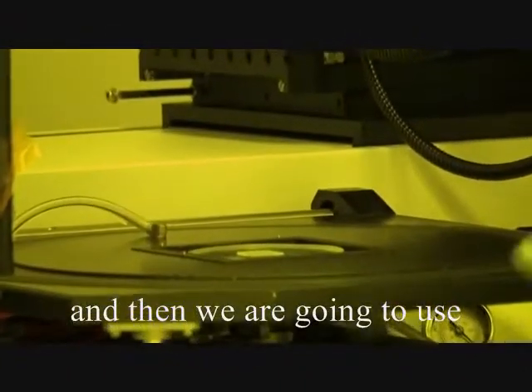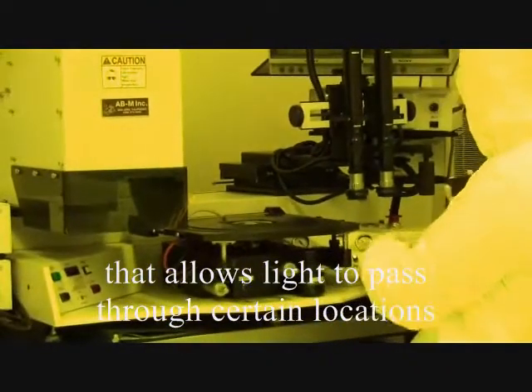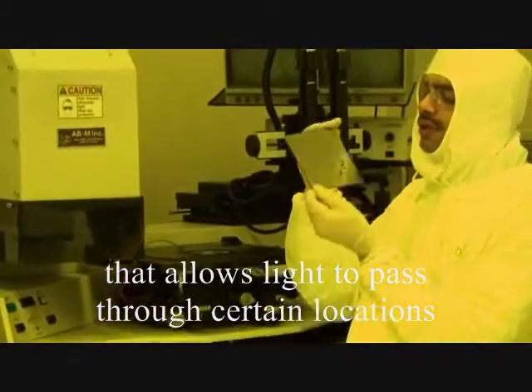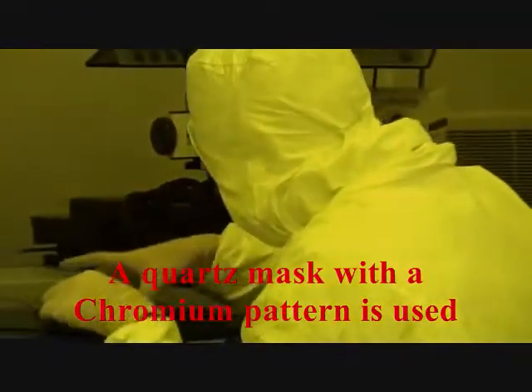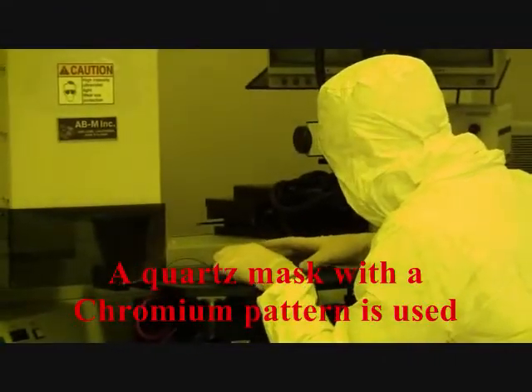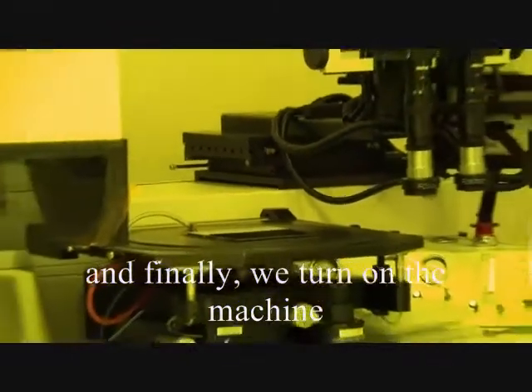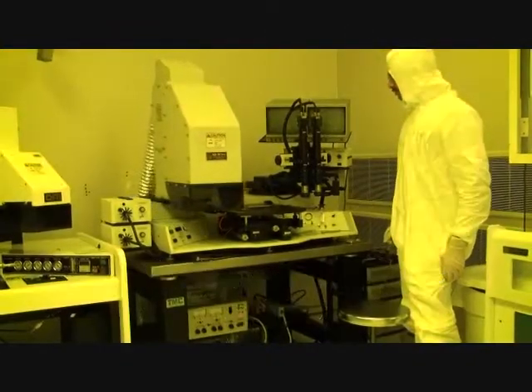We are going to use a special mask that allows light through to certain locations. So we will put the mask first. And finally, we have to turn on the machine.